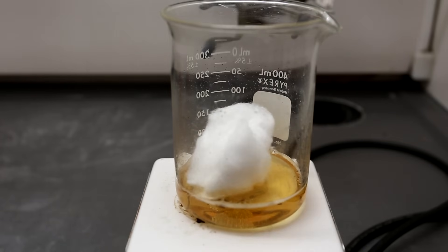Next, we used a clump of cotton which might replicate what would happen if you got some piranha solution onto your clothing.